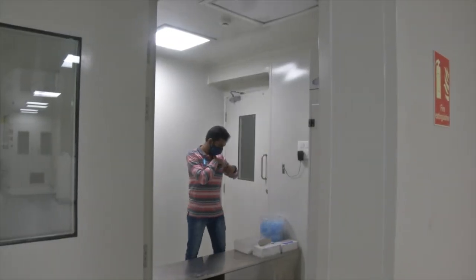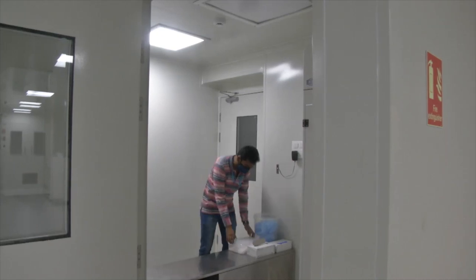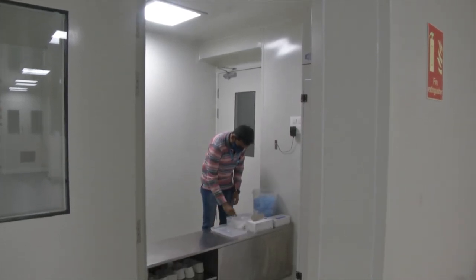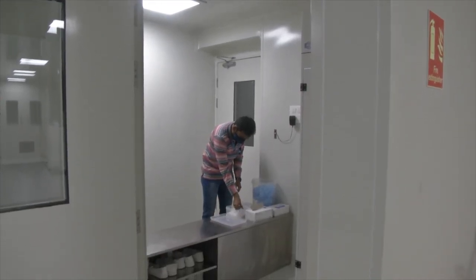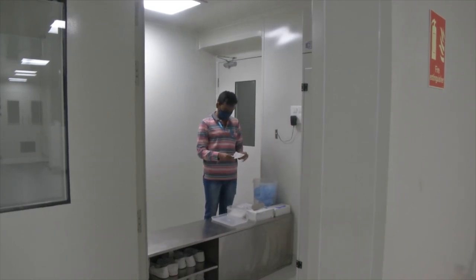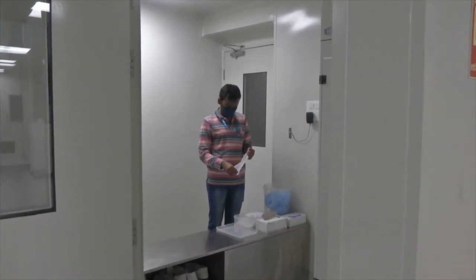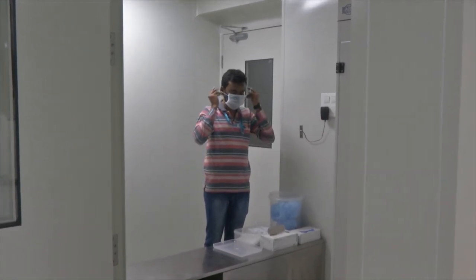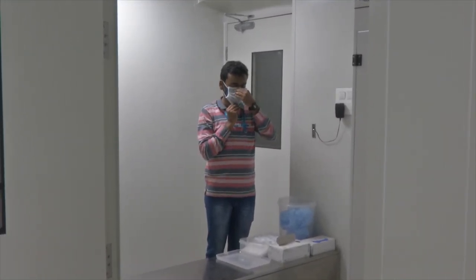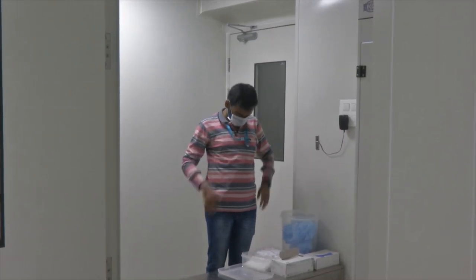The next process is donning of the clean room gown. Donning of the clean room gown is a process that requires sequential steps to be followed strictly. The first step is to wear a mask. As you can see, my colleague is wearing an additional mask on top of the existing one due to COVID protocols.